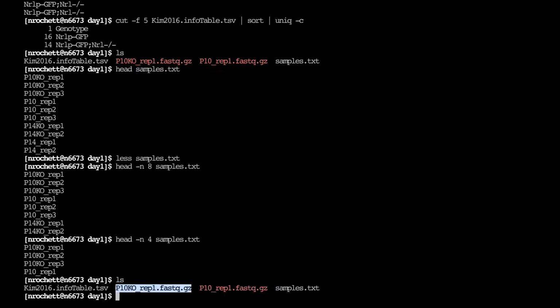And so this kind of brings us to the beginning of the second exercise. And we're going to be working with this P10KO rep1 FASTQ file. And so this is for the P10KO rep1 sample. And again, this sample, it's like the P10 developmental stage. And then this is one of the knockout samples. And then there's the first replicate for this particular combination of developmental stage and genotype.